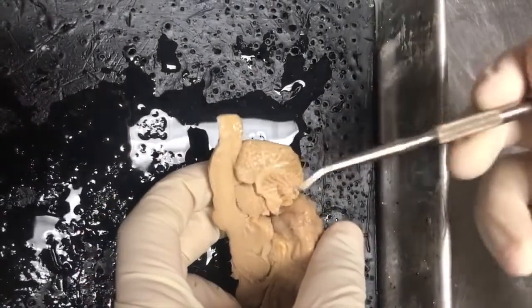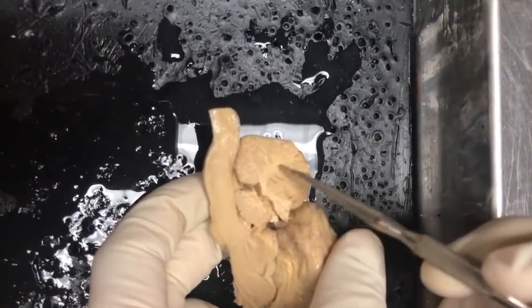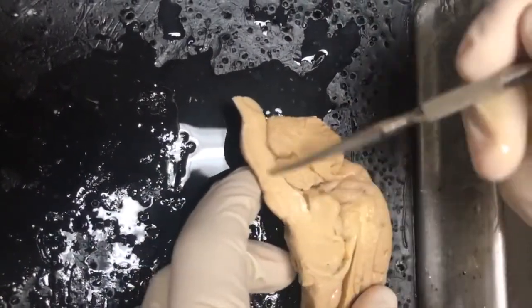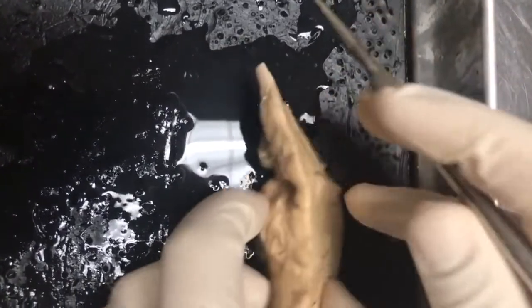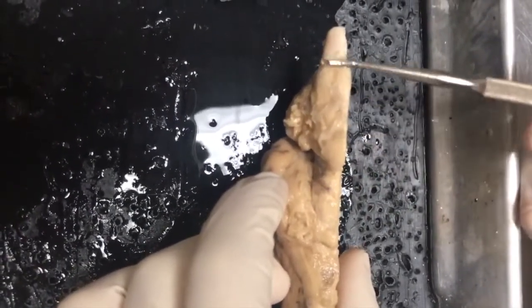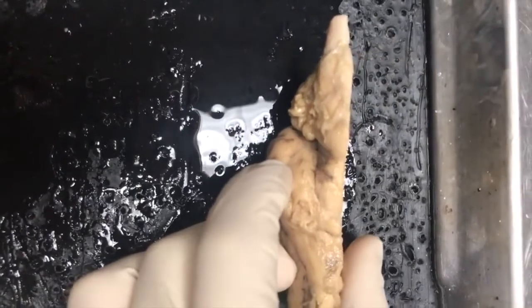On the sagittal cut of the cerebellum, you can see this tree-like structure, which is known as the arbor vitae, Latin for tree of life. And then looking down at this long structure, this is your brainstem, just from a different view. So if you remember from the other video, you have midbrain, pons, medulla, and then spinal cord, which is not part of the brainstem. So midbrain, pons, medulla.